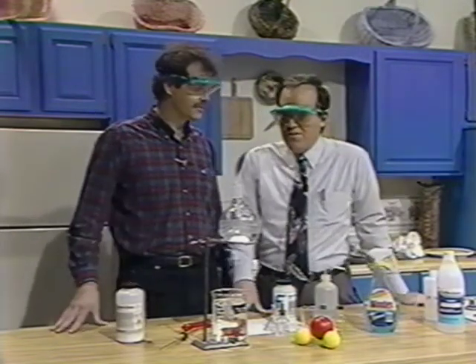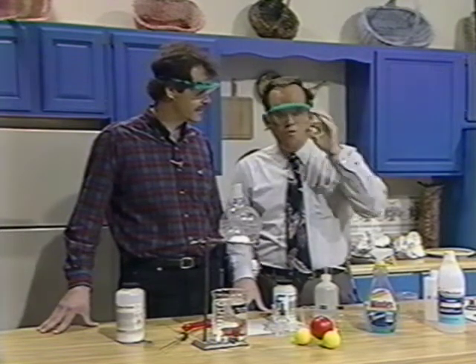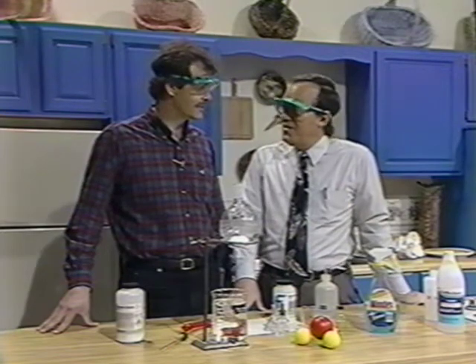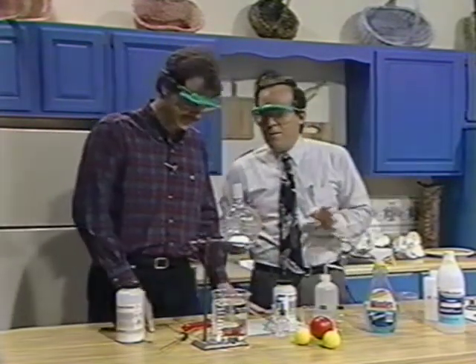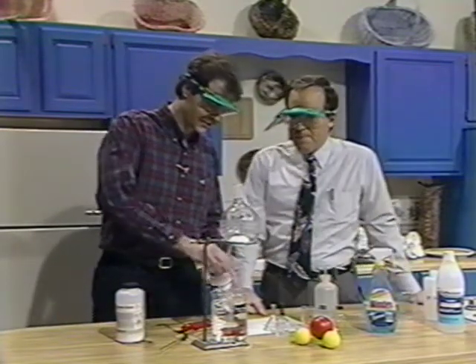Knowing the geometry of a molecule helps us explain and predict its behavior. This is more for the camera people to understand — it's a visual world we live in. What are we going to do then? I told everybody we're going to make an ammonia fountain, and I need to get that started because it has to bubble a few minutes.